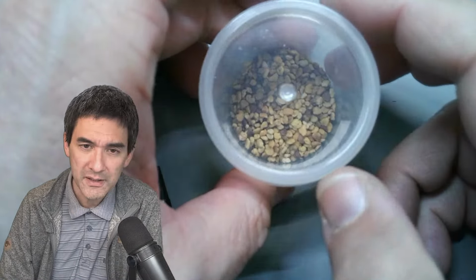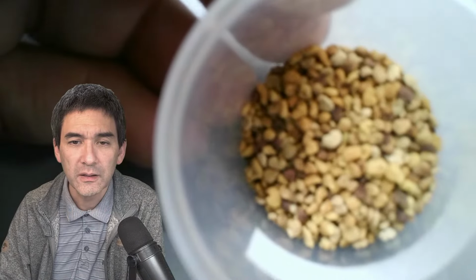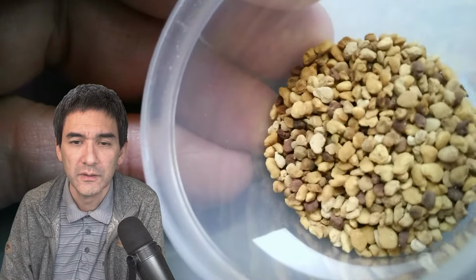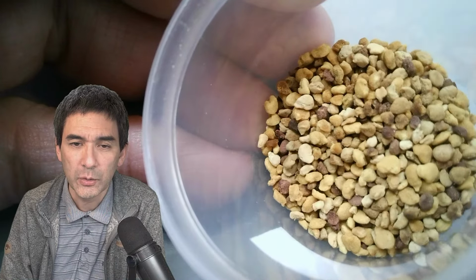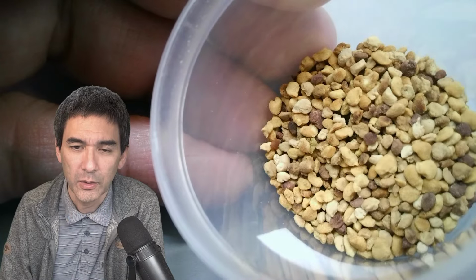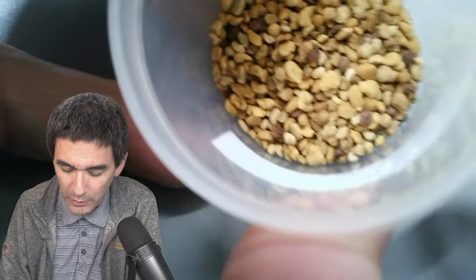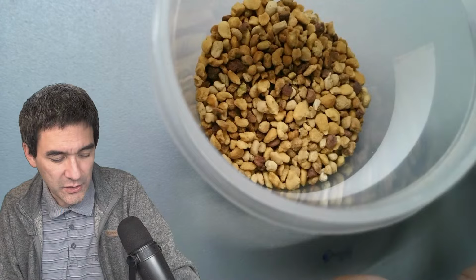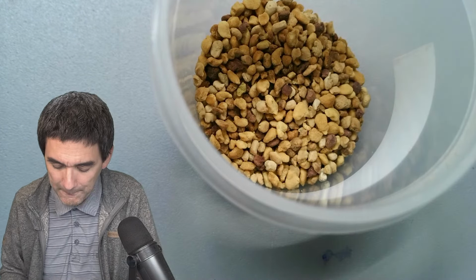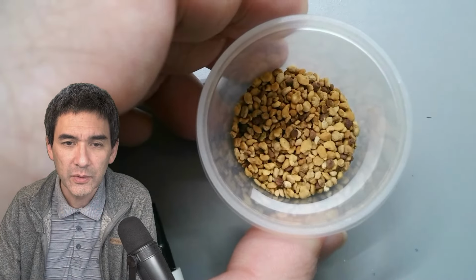So those are basically the pollen baskets of bees. This is how they look. It's almost like gravel. When bees collect pollen, they make those pollen baskets, and they stick to one of the legs of the bee. This is compressed pollen, and obviously it's not fresh anymore, and maybe that's the reason why it did not germinate. But it's a very nice source of pollen to observe, and what you do is the following.